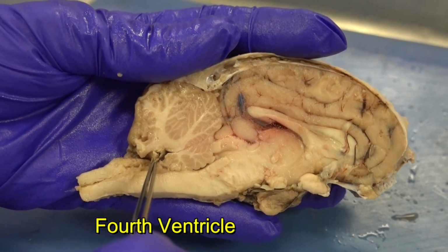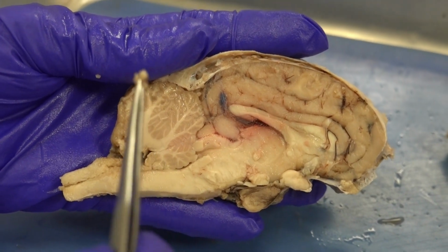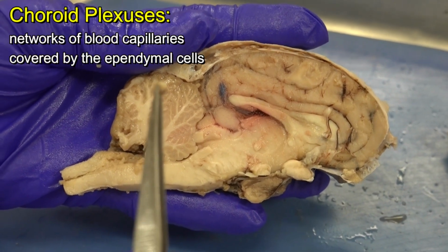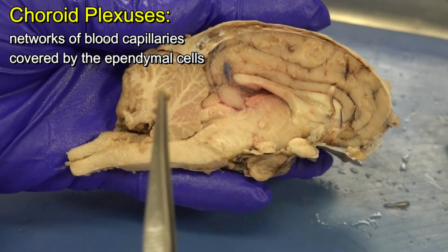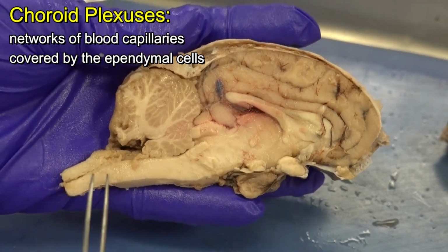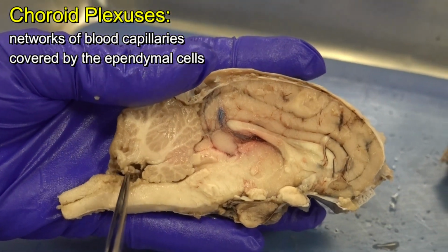And what I do, I get some blood vessels out, but if we analyze this under the microscope, aside from blood capillaries, we find some ependymal cells. Recall, ependymal cells are some of the neuroglial cells. In those blood capillaries that we have here, filtration of blood happens.